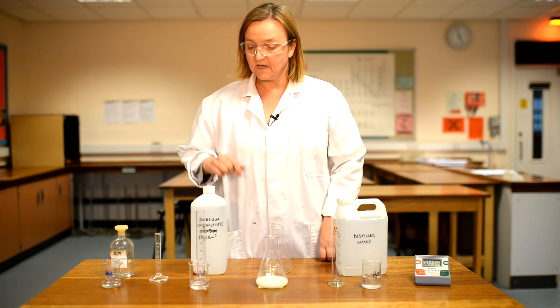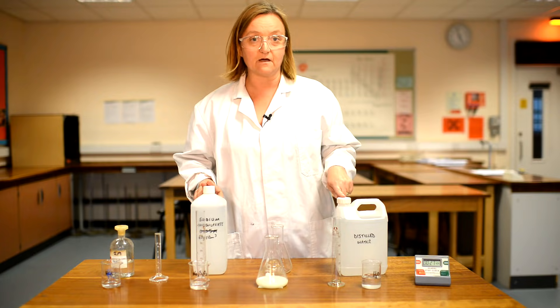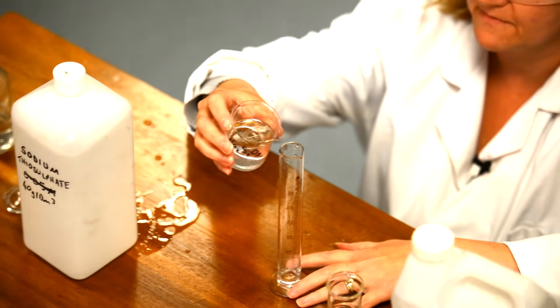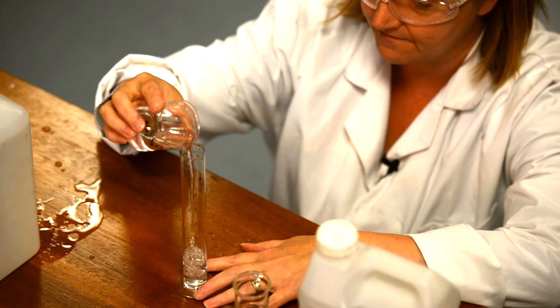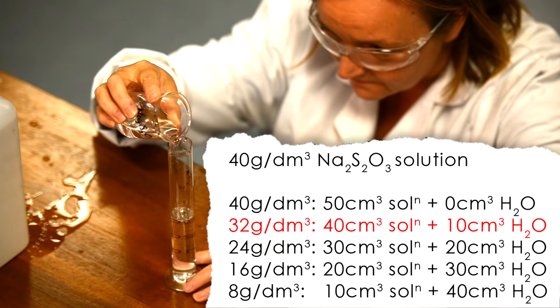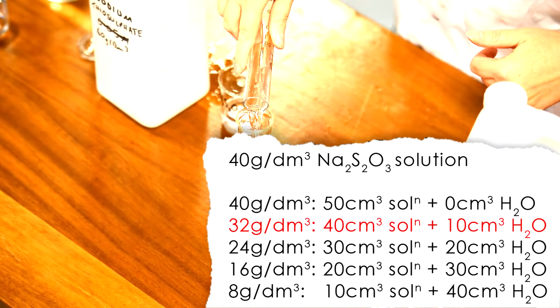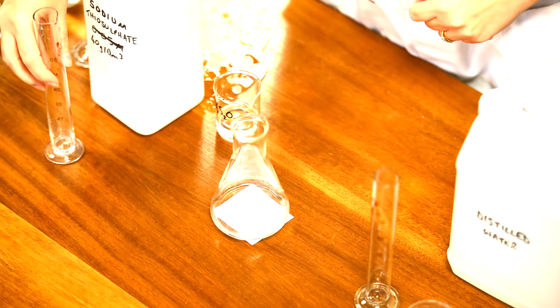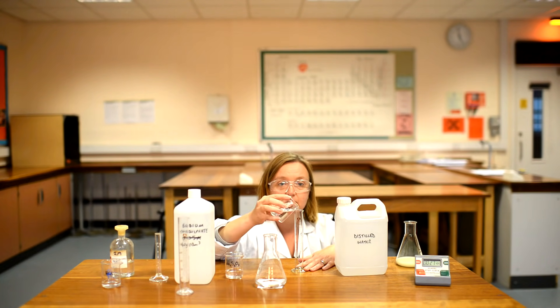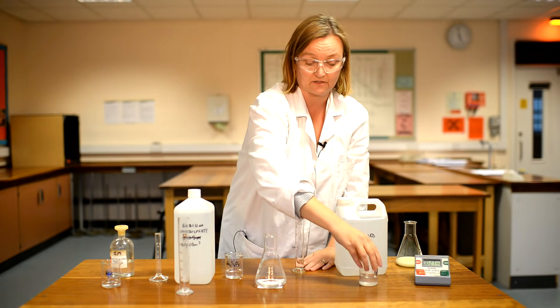That was the most concentrated solution. Now I can vary the concentration by mixing different proportions of sodium thiosulfate with distilled water, keeping the total volume at 50 centimetres cubed. This time I'm measuring out 40 centimetres cubed, carefully slowing down near the 40 mark, then pouring that into my flask and adding 10 centimetres cubed of water — keeping the volume constant at 50 but reducing the number of sodium thiosulfate particles.